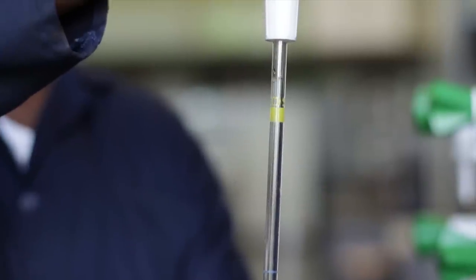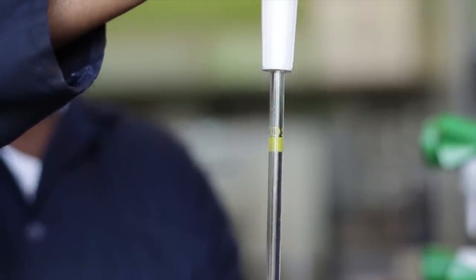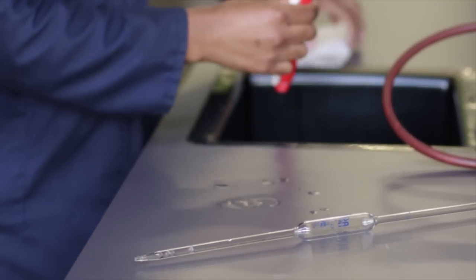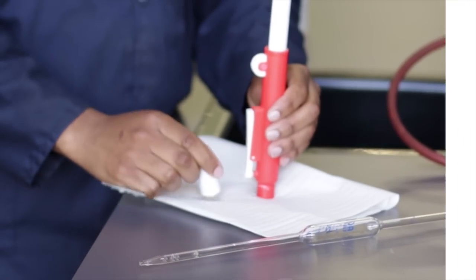If the cleaning solution is sucked up into the pro pipette, the pro pipette should be removed and dried using paper towel before the pro pipette is reused.